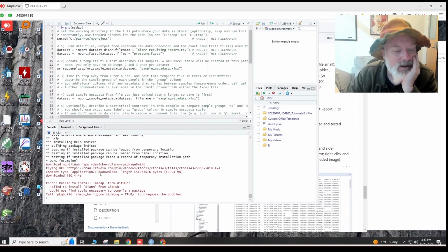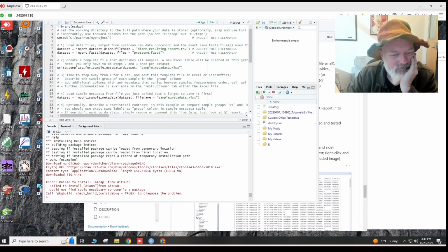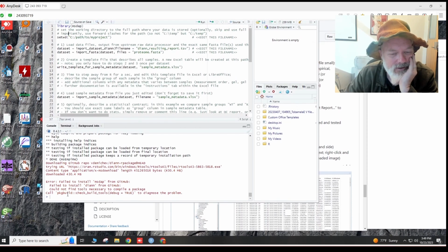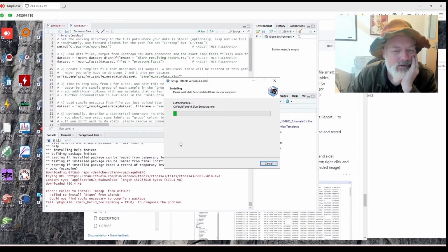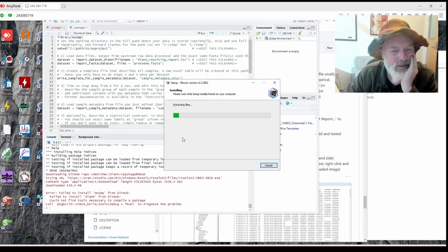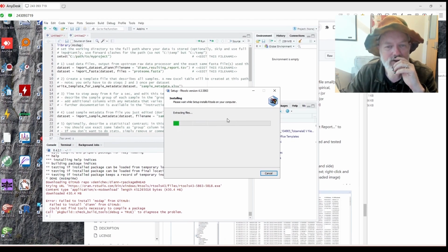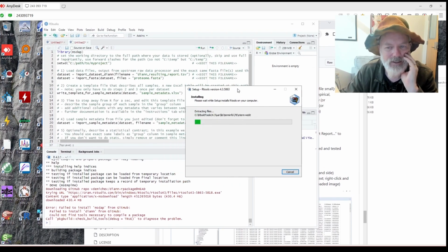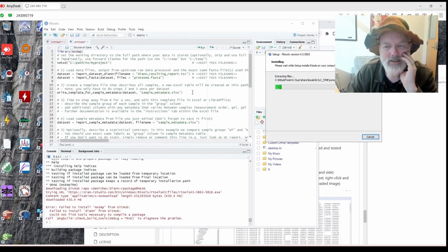So, oh wait, so here we go. Failed to install. These are kind of problems we have. Failed to install DIANN from GitHub. Cannot find tools necessary. Oh, what the heck? Oh, okay. Now it's installing RTools. I thought I had RTools installed. Okay, looks like it's installing RTools already. So if this happens with the current version of RStudio, it looks like it will install it for you. So this is why we're rebuilding this. We're doing this from scratch because it's always a pain in the butt to do that.